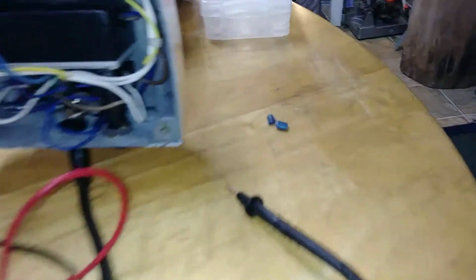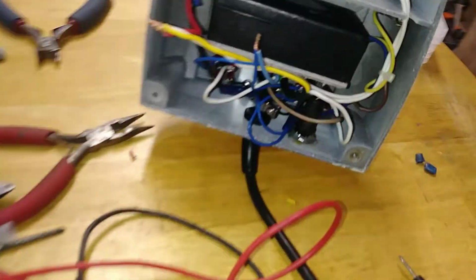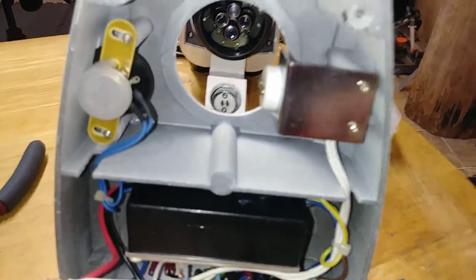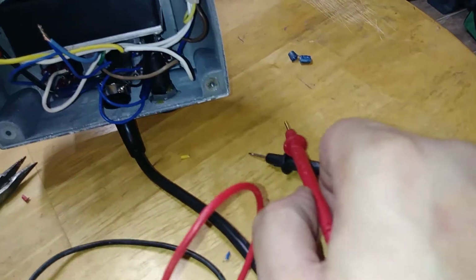So just to start with, this is an alternating current system, okay? Not DC, AC. It plugs into the wall, as you can see, right into the system. So it's high voltage right out of the wall. You can get electrocuted. What I'm doing, you should not attempt unless you're a pro. Alternating current versus direct current: direct current has a positive lead and negative lead.